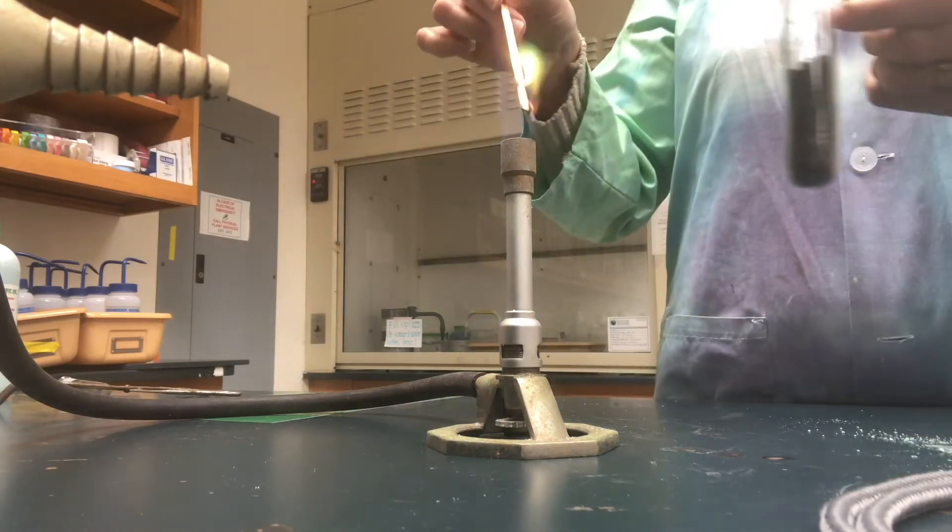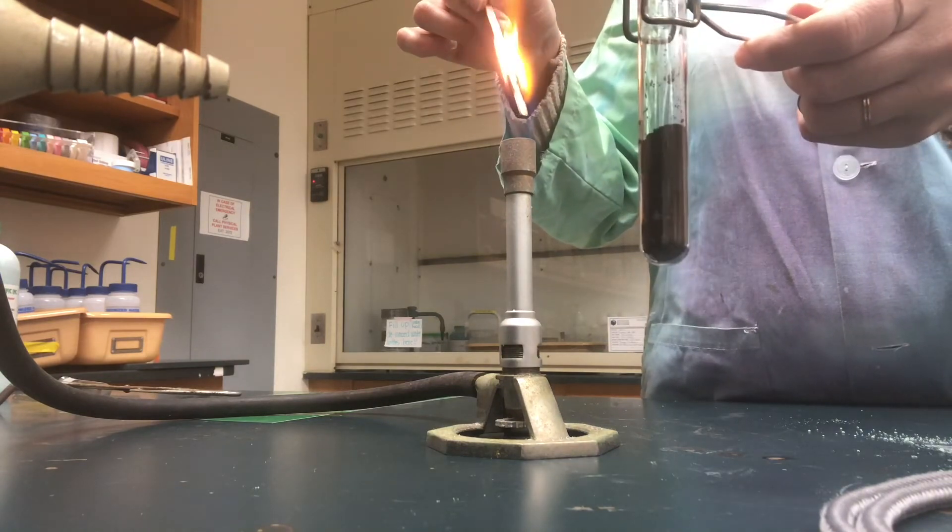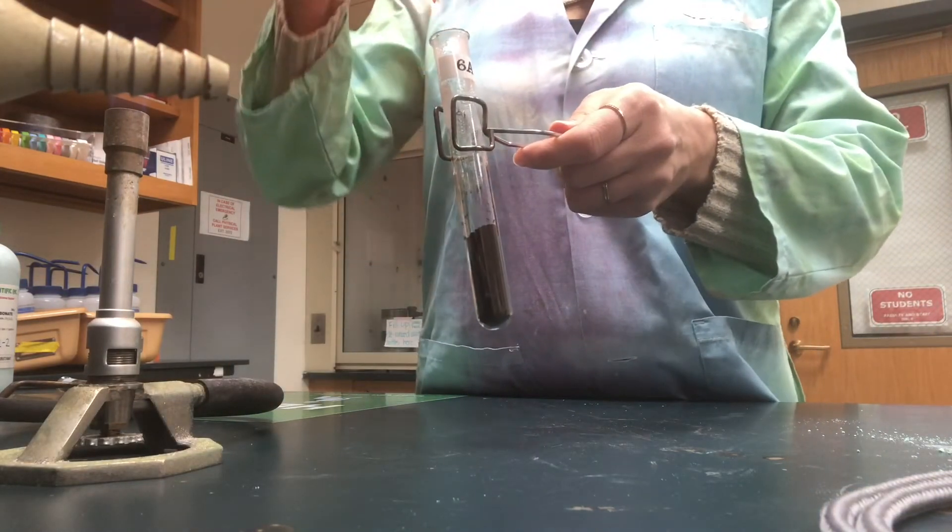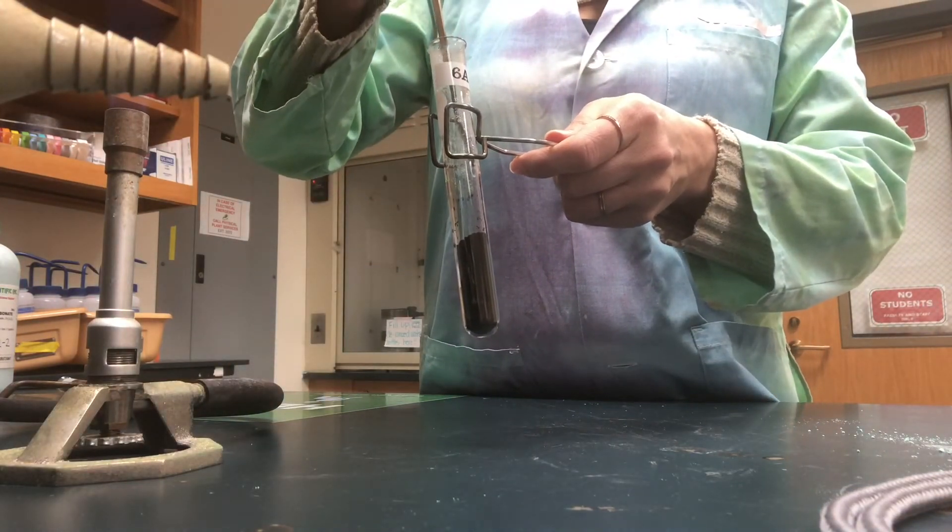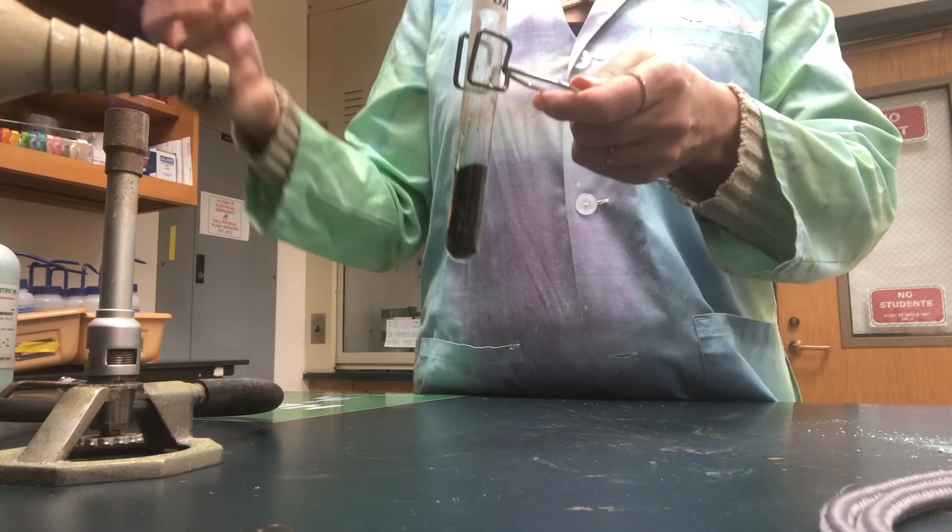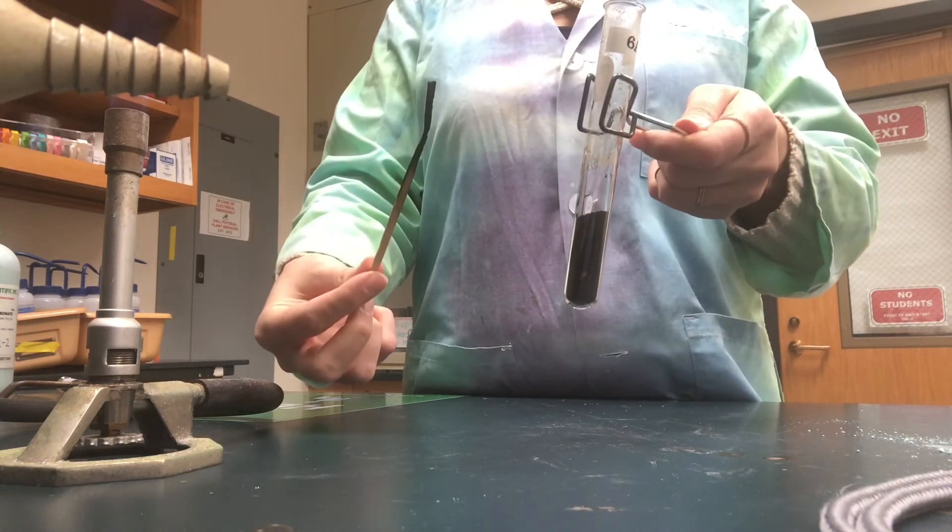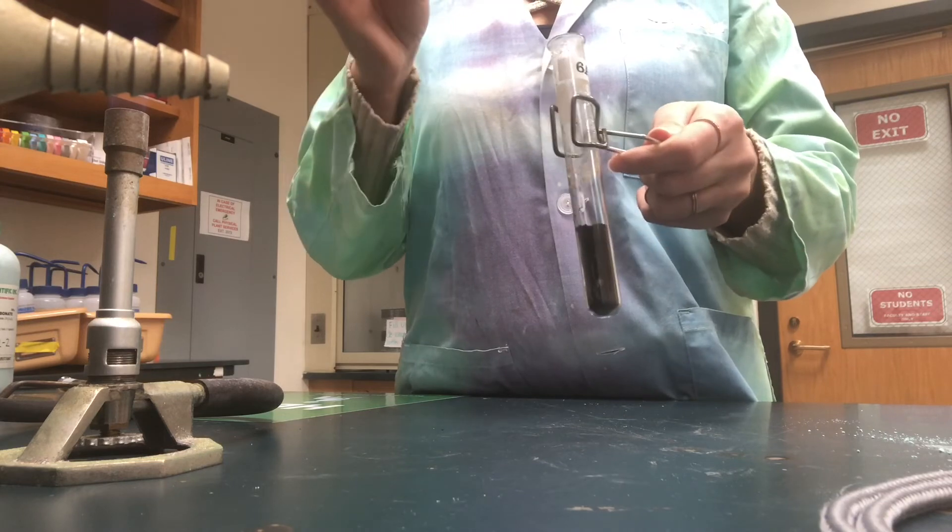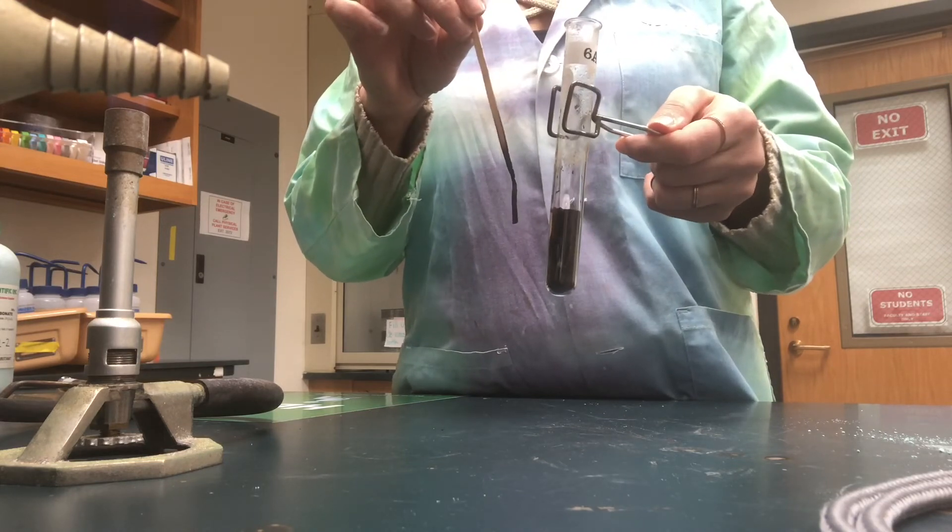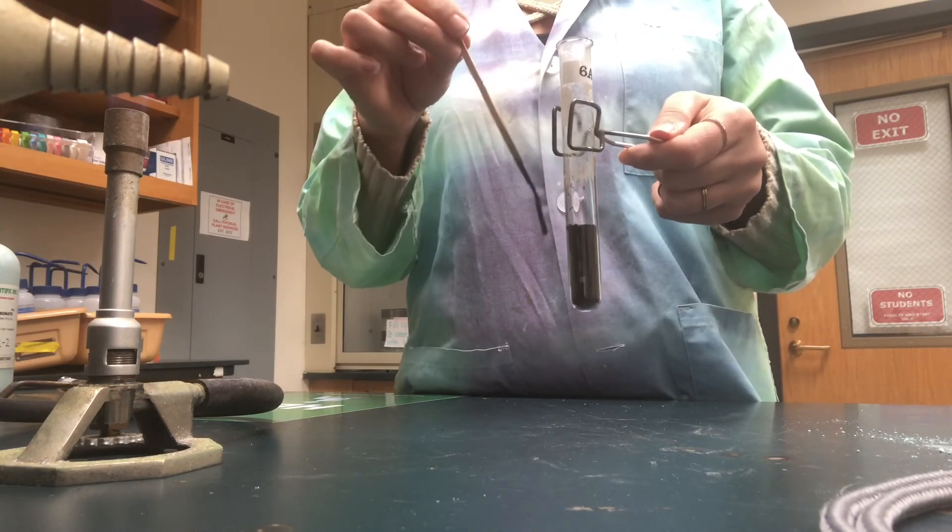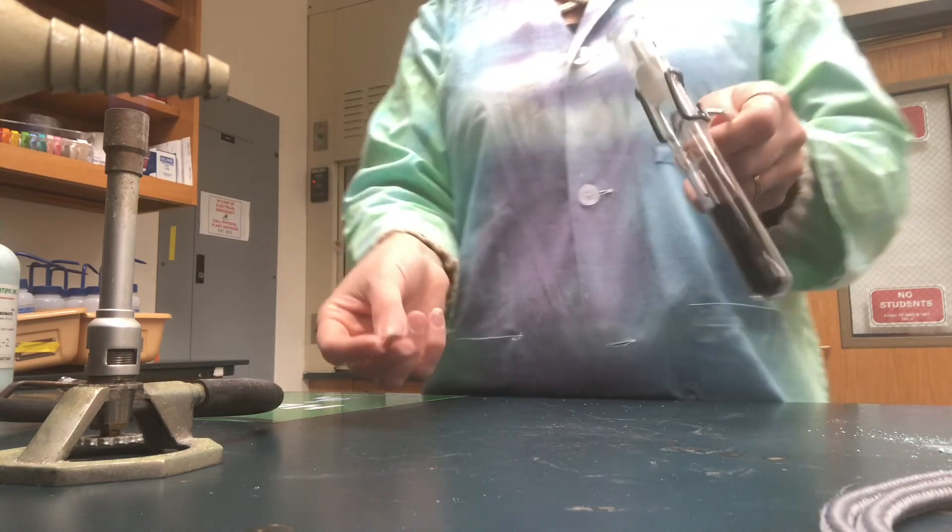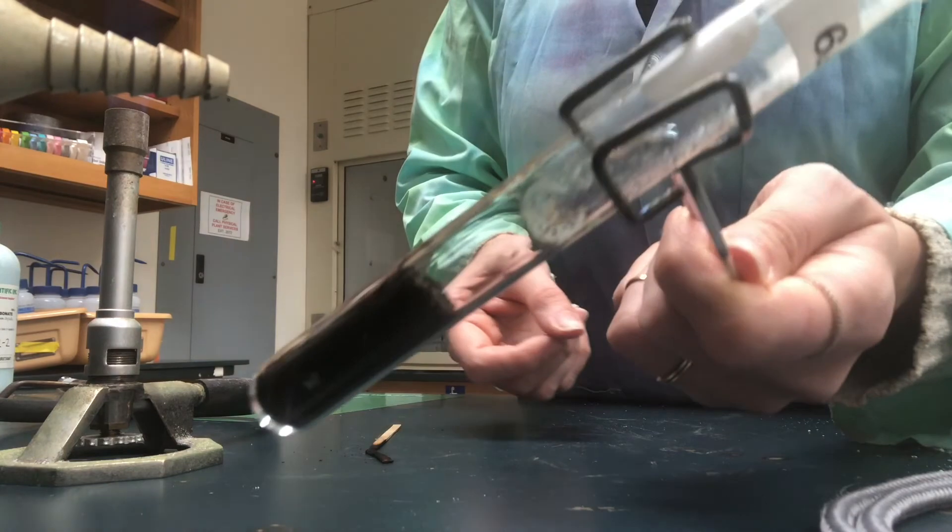Notice it's on fire. I'm going to take that flame and insert it inside the test tube where the gas is present. If you notice the flame extinguished. The presence of a gas can either make the flame extinguish, ignite even more, or make a popping sound. In our reaction, our flame extinguished, so that means a certain gas is present.